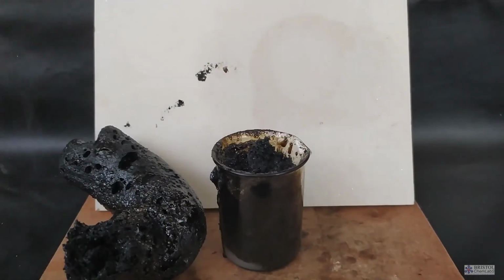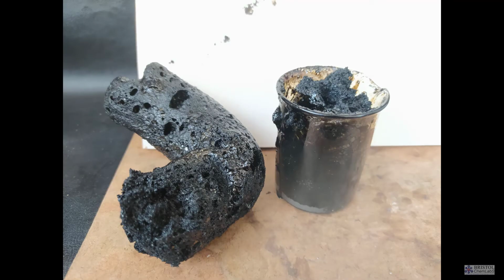The upside of this experiment is there is a lovely smell of caramelized sugar produced.